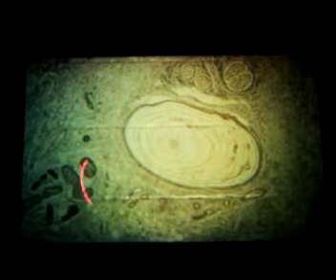This large structure here is a corpuscle of Vater-Pacini. Sometimes they call them Pacinian corpuscles. He was a priest, interested in science, kind of like Gregor Mendel. It looked like laminated tree rings. Some people in the past have gotten this mixed up with an osteon, just because of that laminar nature. Here you have your dense irregular connective tissue.